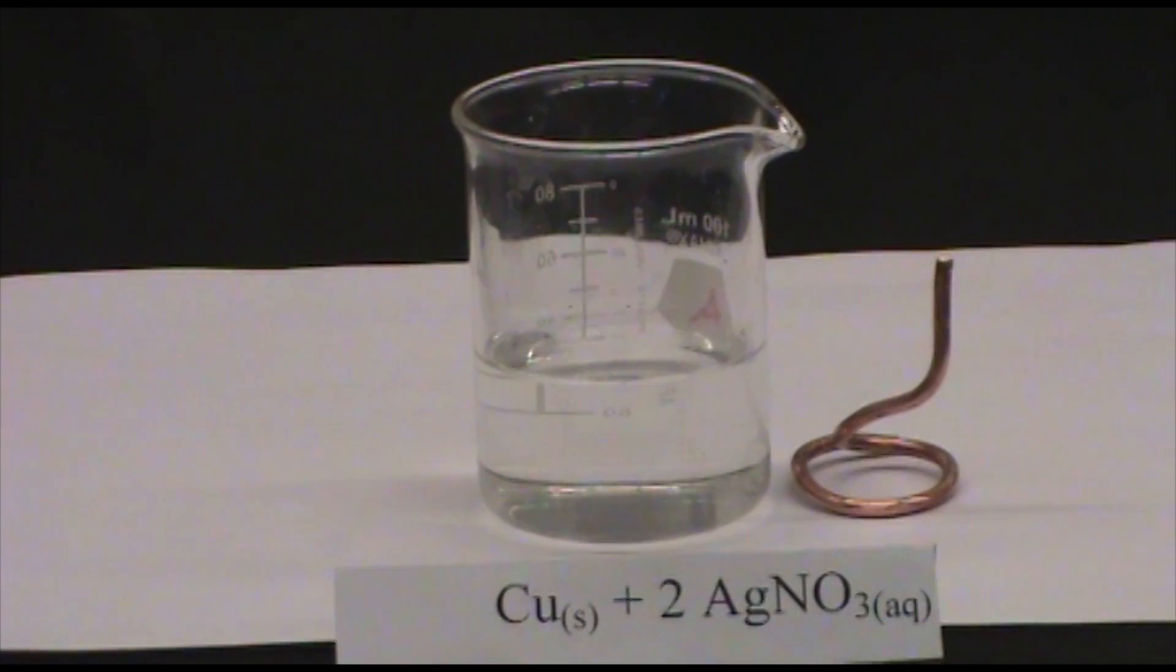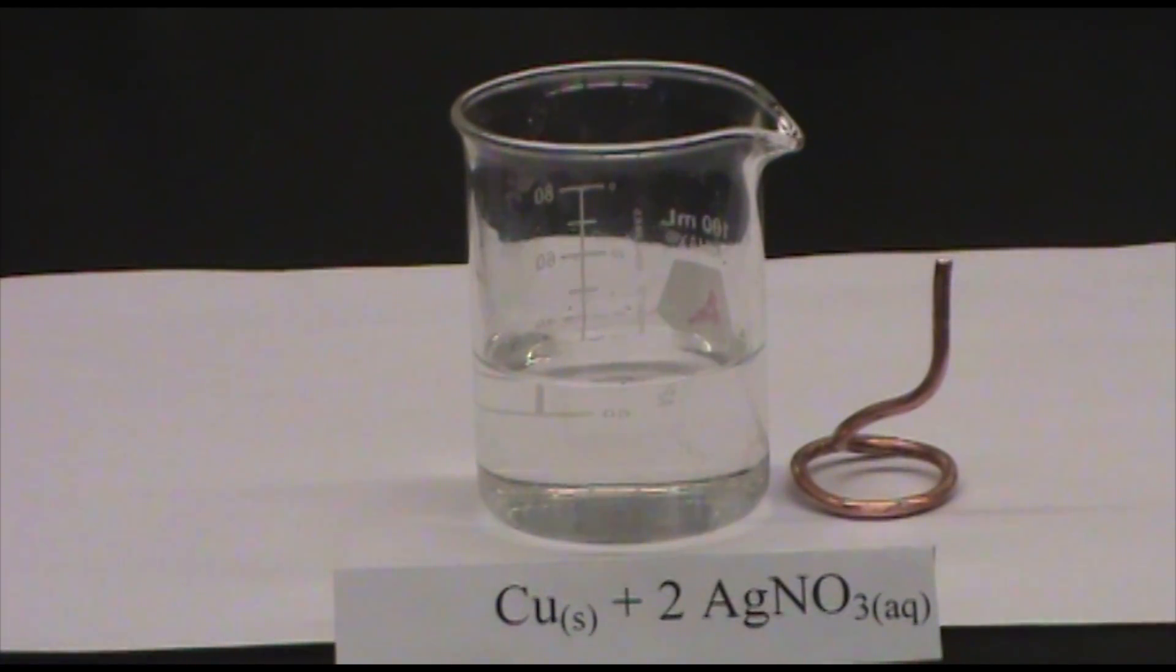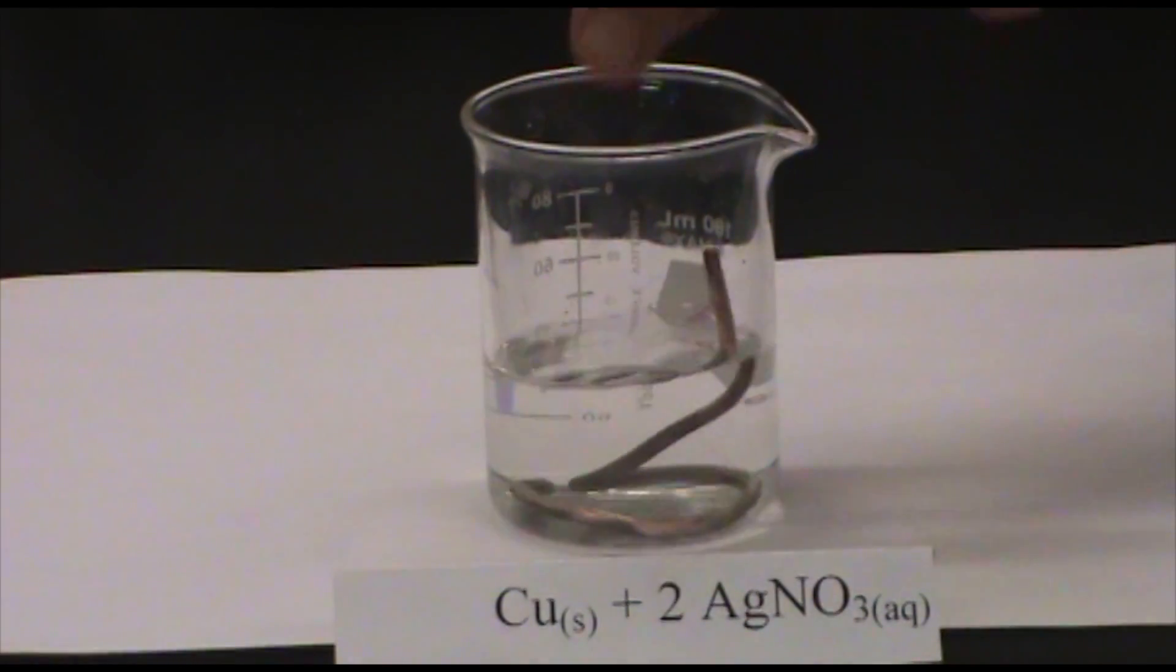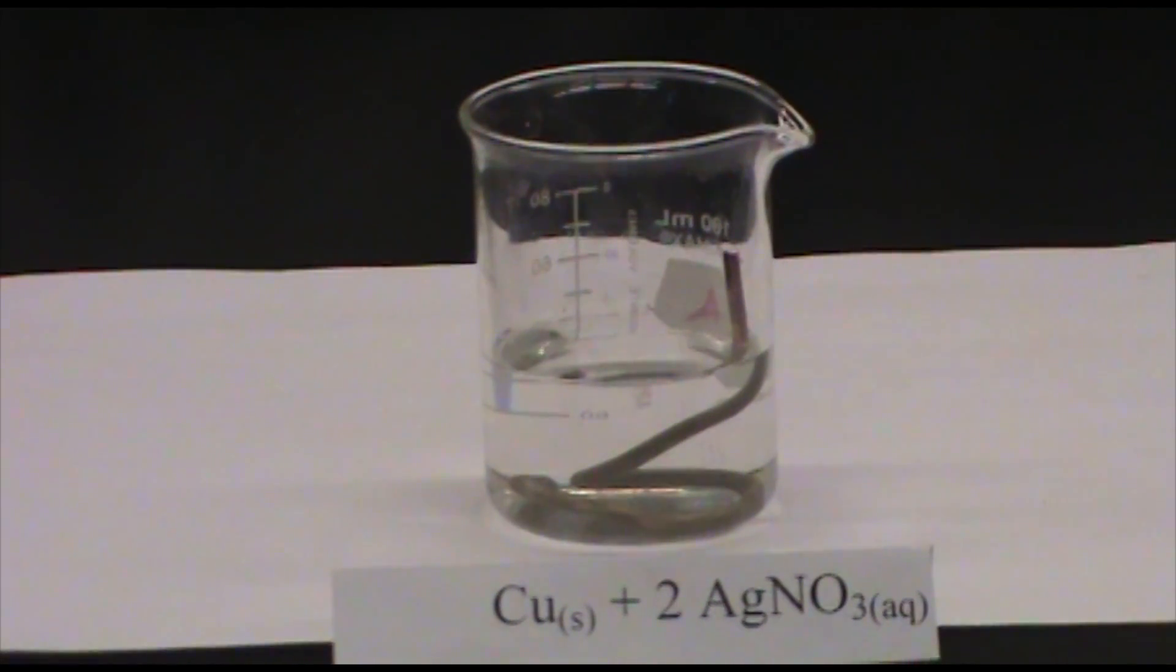The demonstration is a single displacement reaction between silver nitrate and solid copper. When I place the solid copper into solution, it displaces the silver that's in solution.